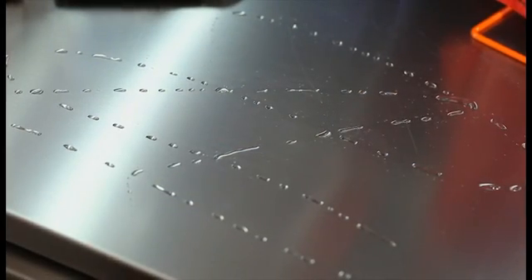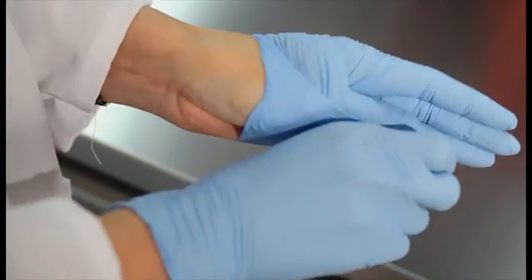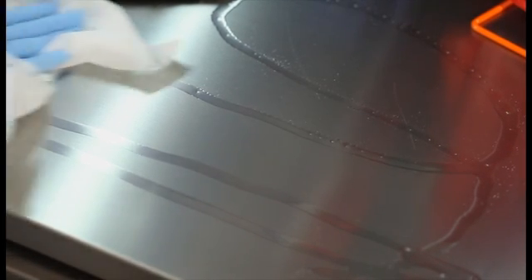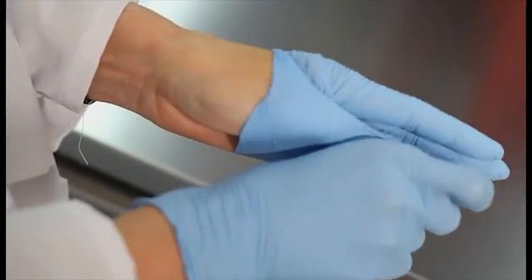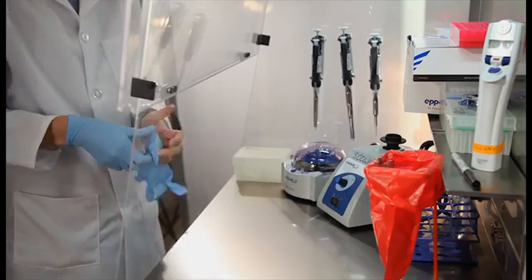Next, rinse the surface with deionized water and change gloves again. Finally, wipe surfaces with 70% ethanol and change gloves once more. Changing gloves between each cleaning step is important to prevent contamination.